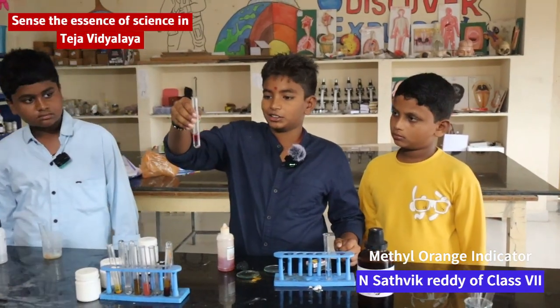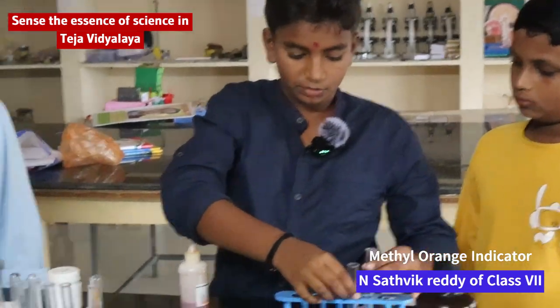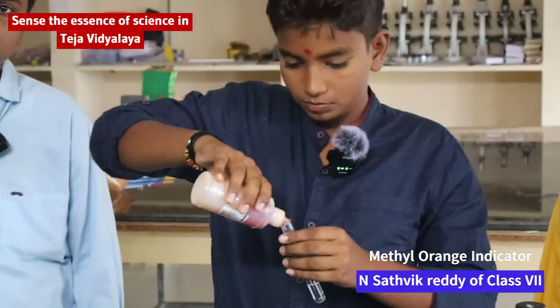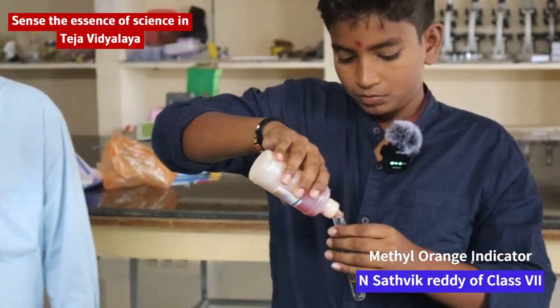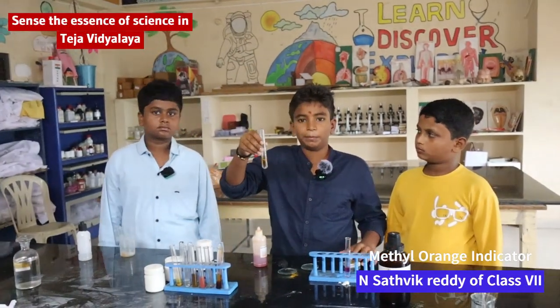It changes its color. It is acid. It changes its color to yellow because it is a base.